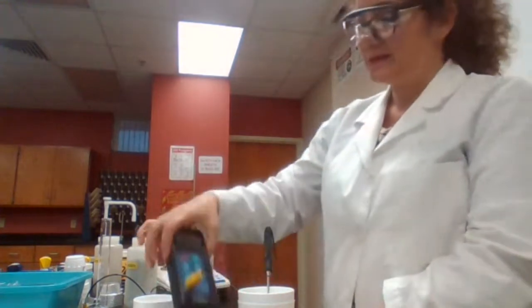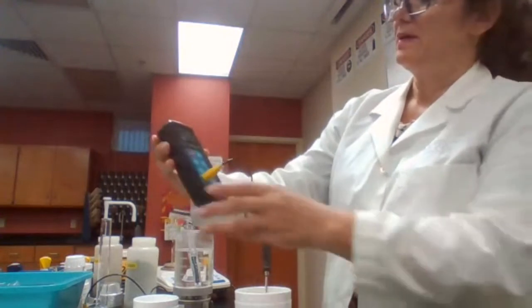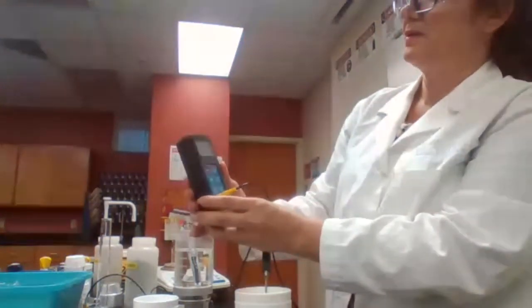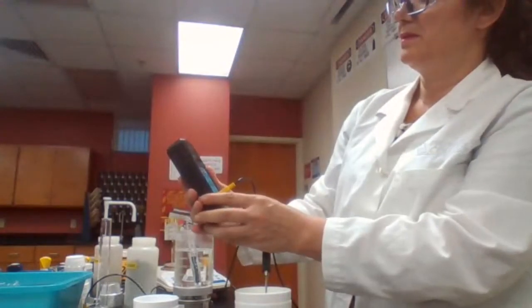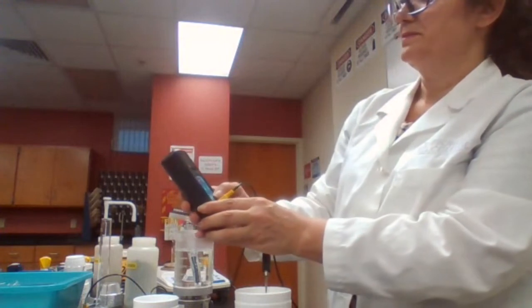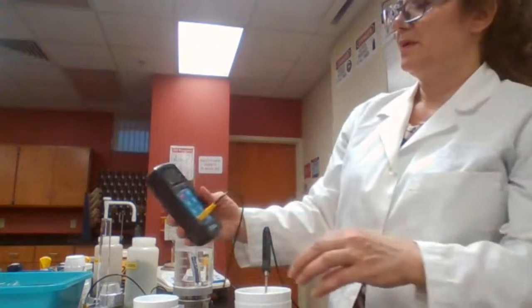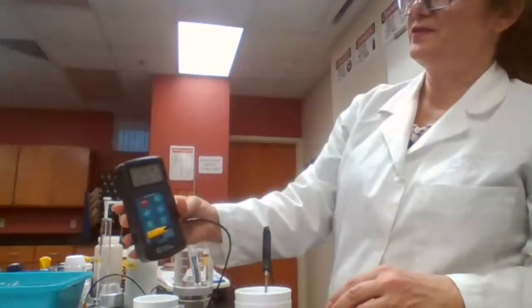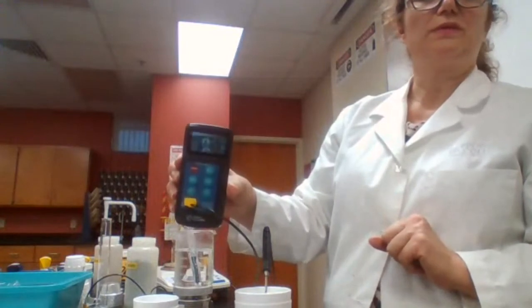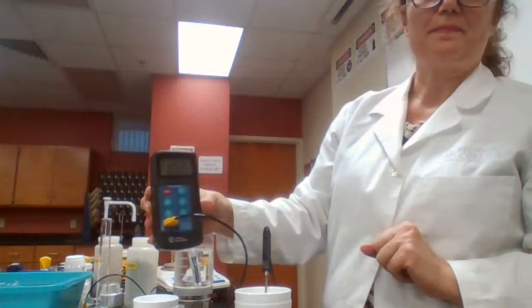And that is 25.5 degrees Celsius. This is the initial temperature for water. 25.5.